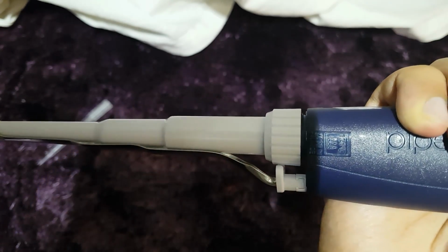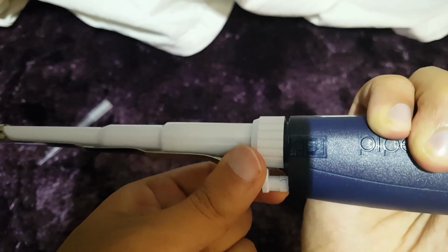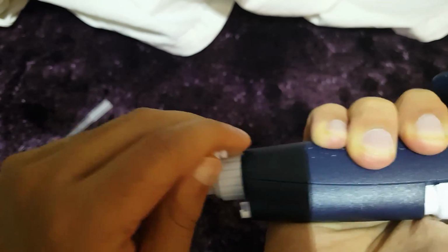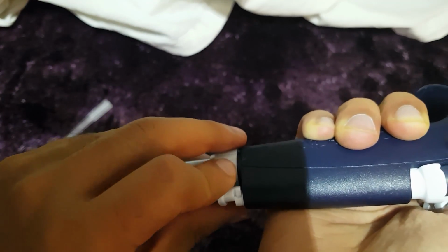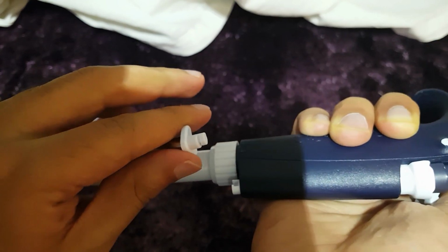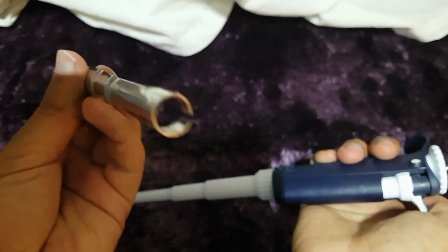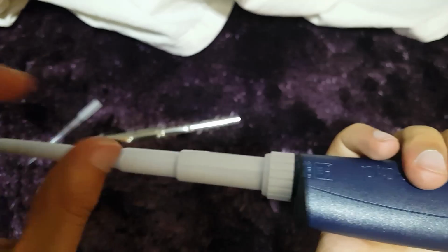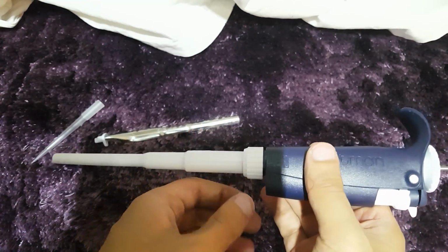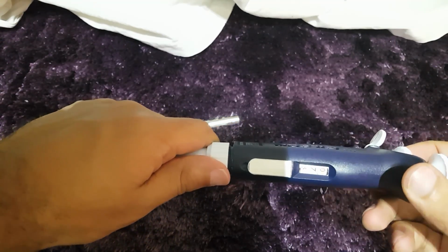Okay, so what we can see here is that there is a little hole. What we have to do is try and get the arm out of there. You see, it simply clicks out of there. You push it up here, you hear it click, and you can take off the ejector arm, which you can clearly see there. Now, we come to the main body of the pipette. This pipette works with springs inside, so the first thing you need to do is unscrew this part here.